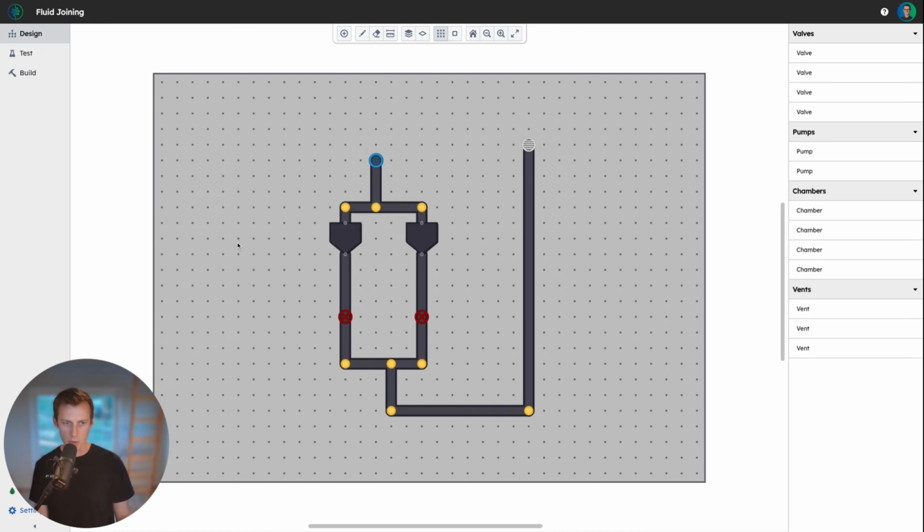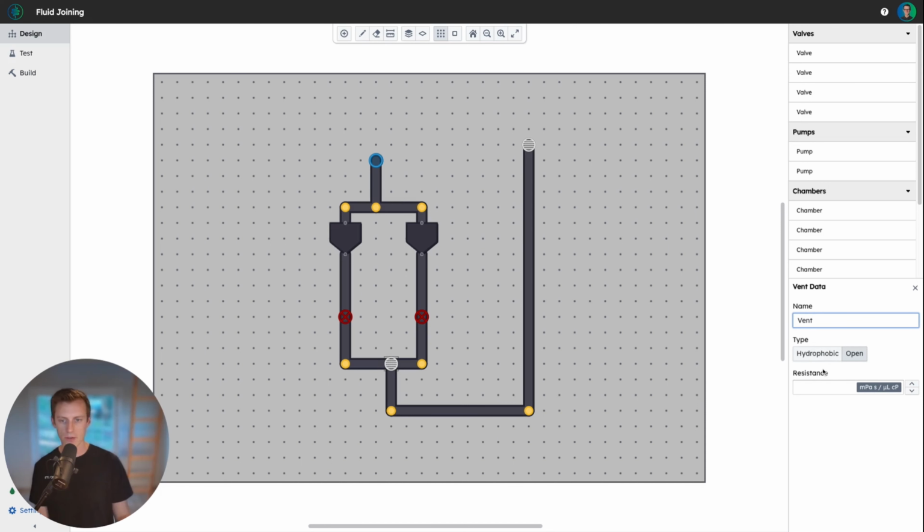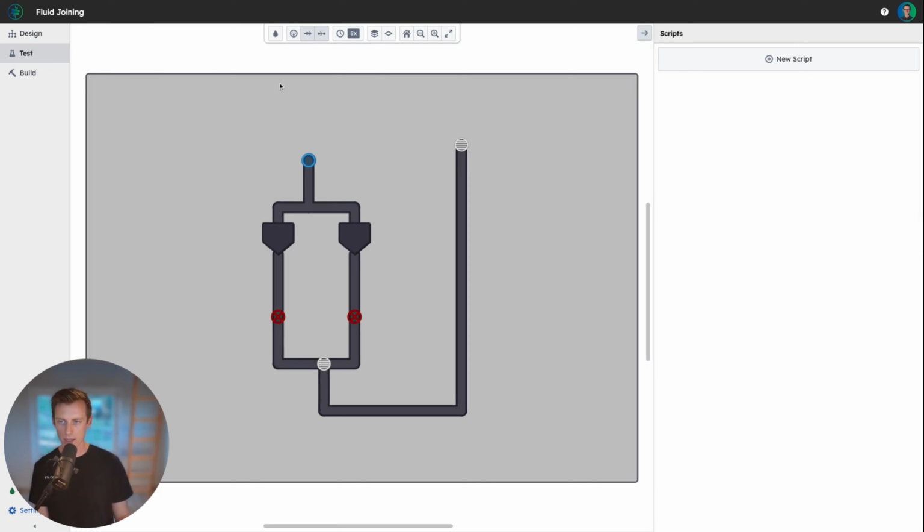So this one is easy. We head back to the design pane, drag a vent component onto the intersection, and then configure the vent as hydrophobic. So let's see how that impacts the system by trying it again.